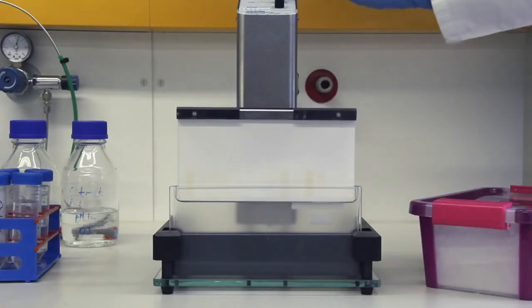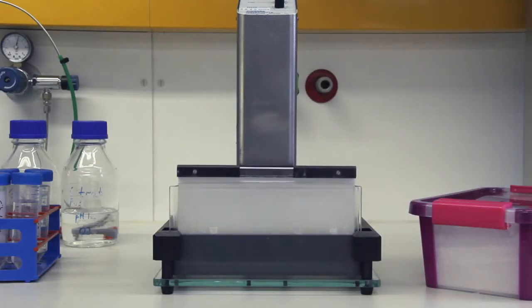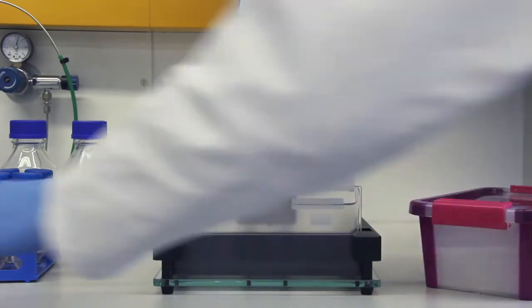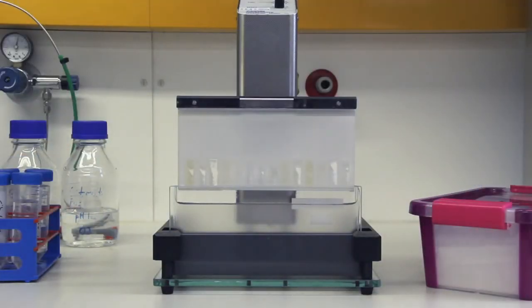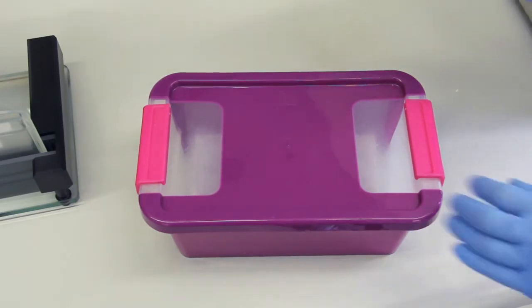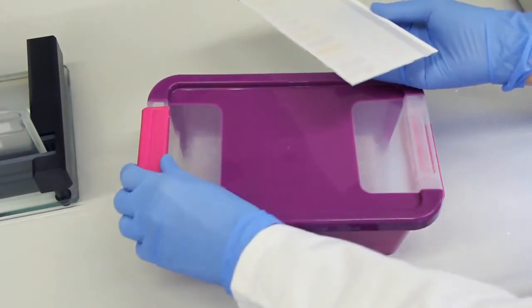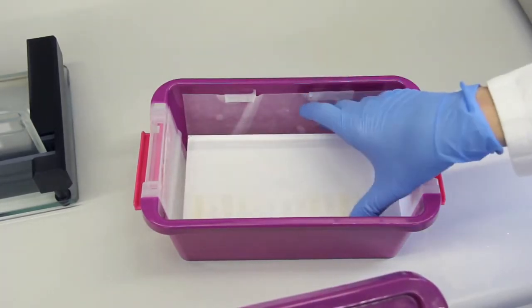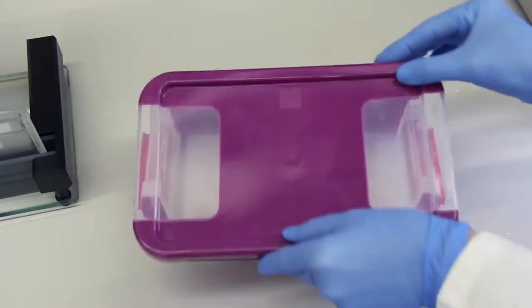For biodetection of the estrogen effective analytes, the developed plate was automatically immersed into the cell suspension for 5 seconds, using the chromatogram immersion device at an immersion speed of 3.5 cm per second. The glass plate's rear was cleaned with a tissue and the sealed plate was horizontally incubated in a plastic box with an almost 100% humidified air surrounding.